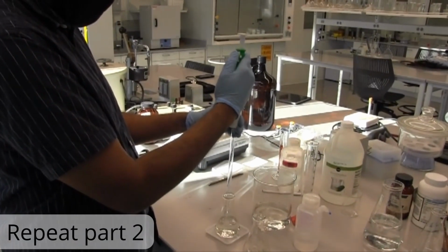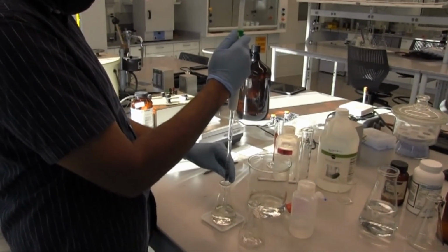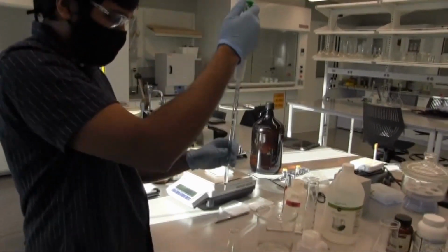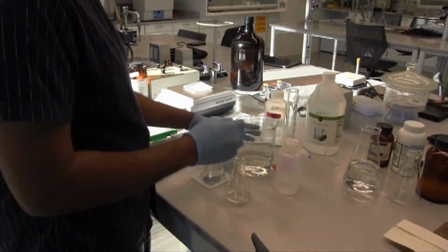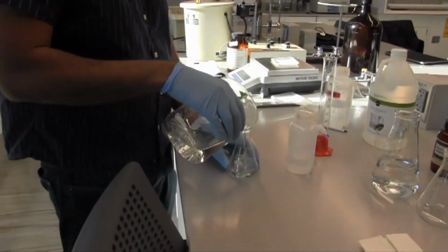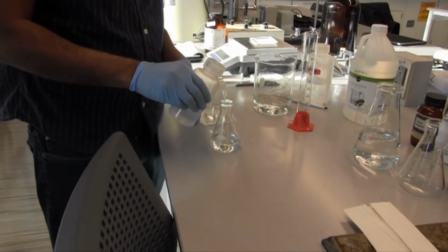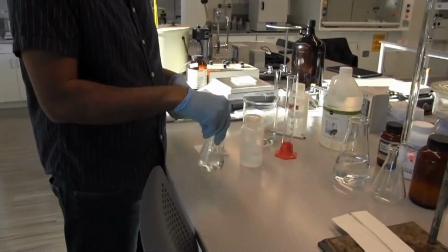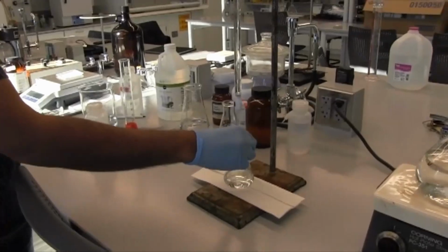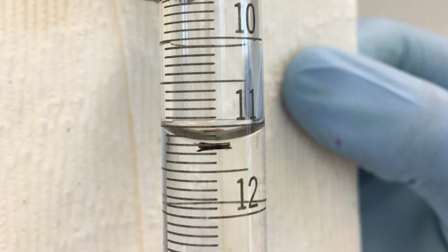Now we'll repeat that to get a second trial. We'll take 10 milliliters of our 10 times diluted vinegar solution, put it into an empty Erlenmeyer flask, add some water, add some phenolphthalein, swirl it, and then we will go ahead and put it underneath the stopcock to start dropping the base into the acid. Here's our starting volume. Go ahead and record that in your notebooks.